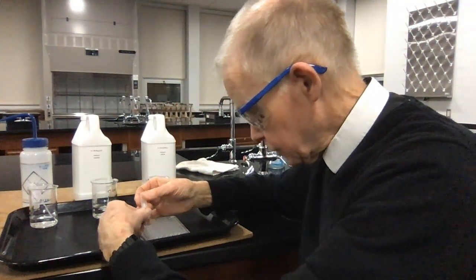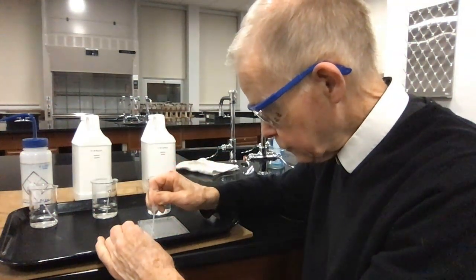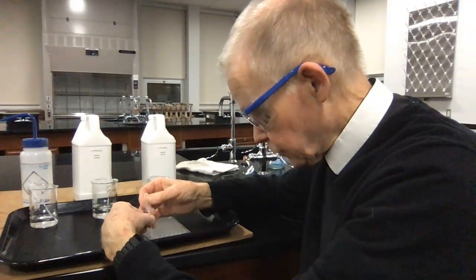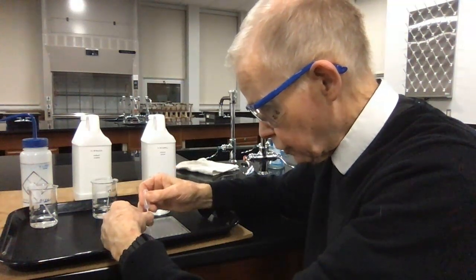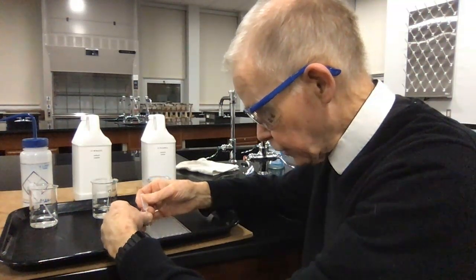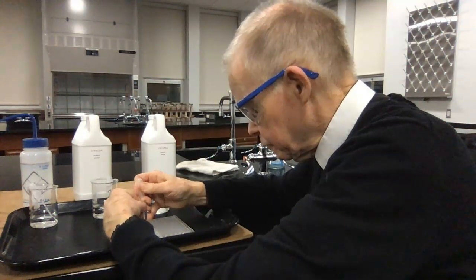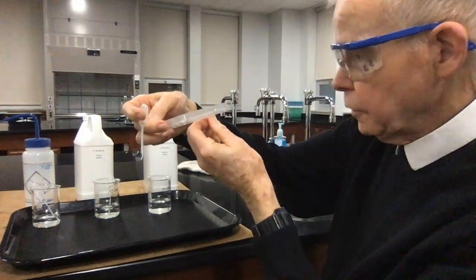I'm now going to take the barrel pipette, suck up all the stuff that's in well 1. I'm going to move it over to well 2, and I'm going to drop 5 drops into well 2. Calcium nitrate back in well 1. As soon as I put the barrel pipette down here in well 2 and draw up the liquid, it'll mix. Now I'll put 5 drops of it into the next well. Okay, so hopefully we have a bit of a dilution there.